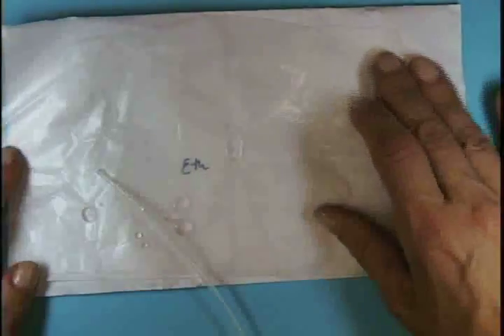Now we're going to put single droplets of ethanol and hexane on dry parts of the wax paper. Okay? The ethanol, we can still see right here, is circular. Okay, we can still see that. Now, can we make it into bigger and smaller drops? Not really. It just kind of flattens out.